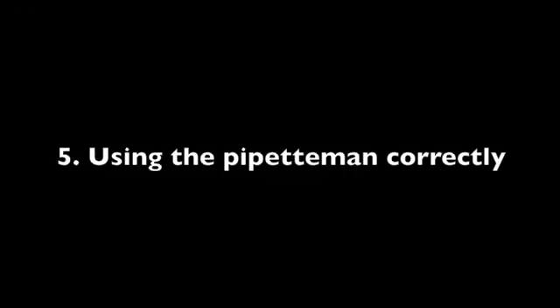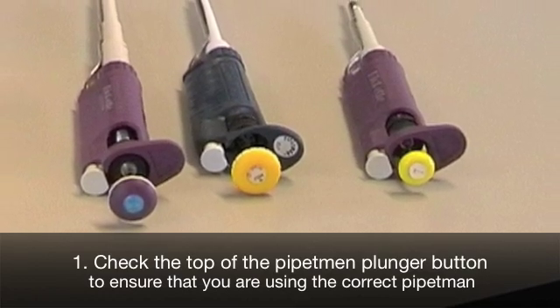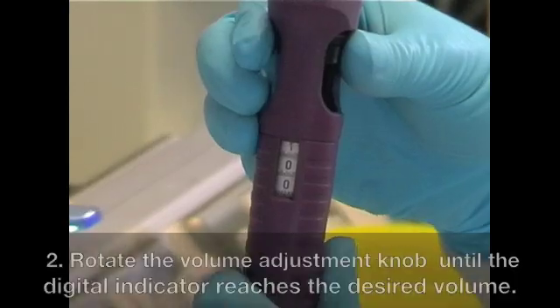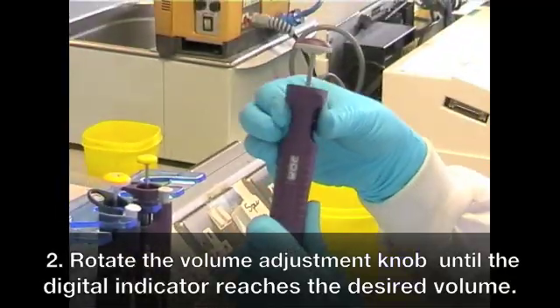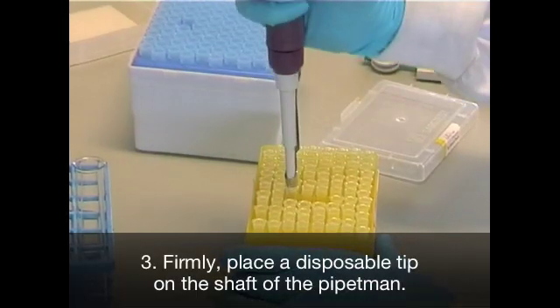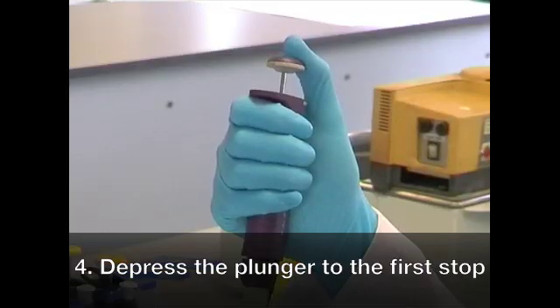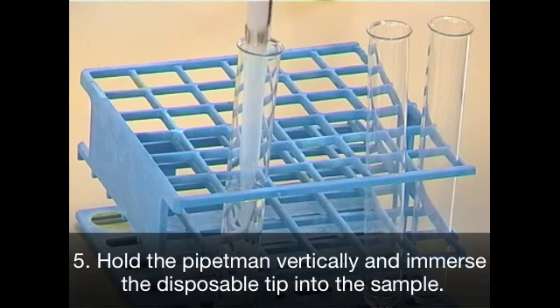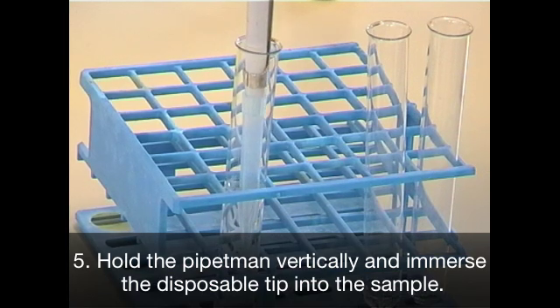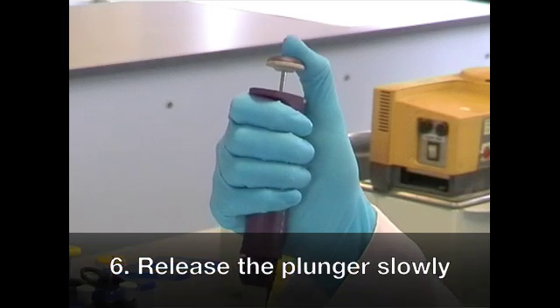When using the pipetman, there are a series of steps you should follow to ensure accurate pipetting. Firstly, check the pipetman plunger button to make sure you're using the correct pipetman. Step 2. Rotate the volume adjustment knob until the digital indicator reaches the desired volume. Then, firmly place the disposable tip on the end of the pipetman. Then depress the plunger to the first point of resistance. Step 5. Hold the pipetman vertically and immerse the disposable tip into the sample. Release the plunger button slowly to its original position.